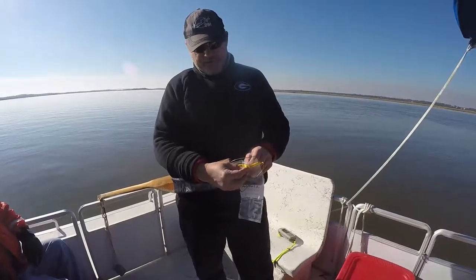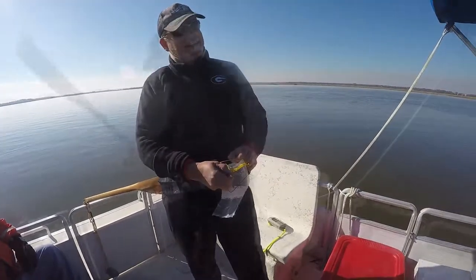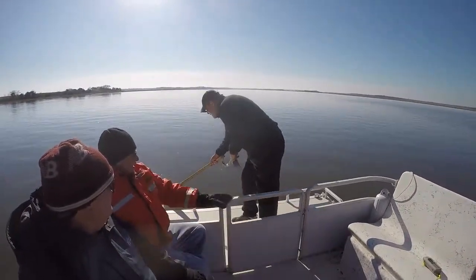This device is set up so that you have not opened the bag until you are ready to test. It looks like you're ready.